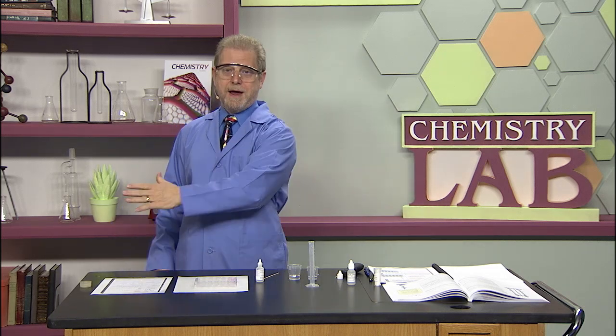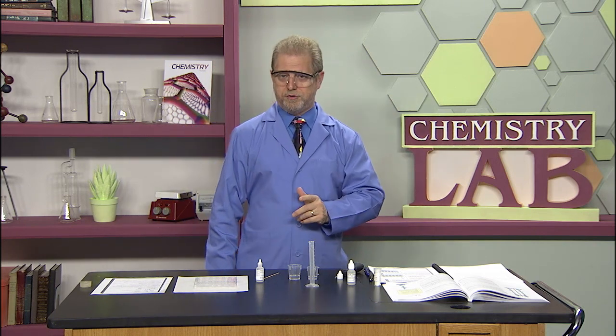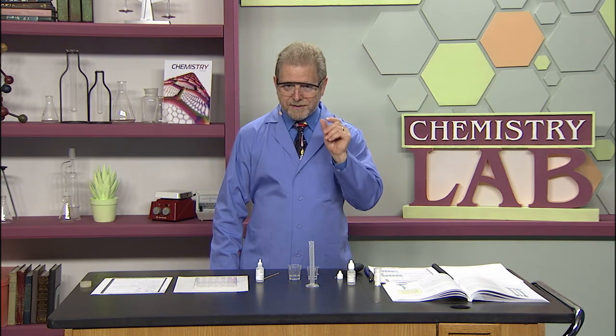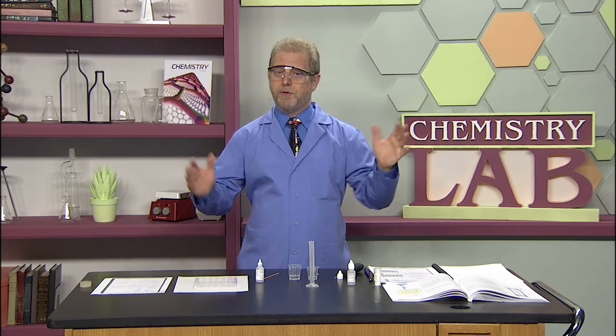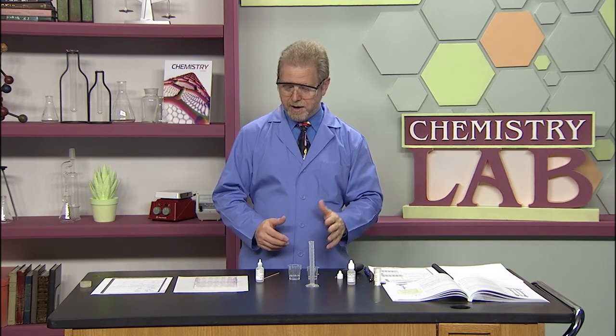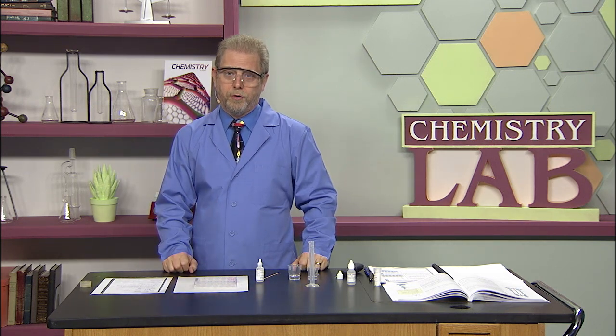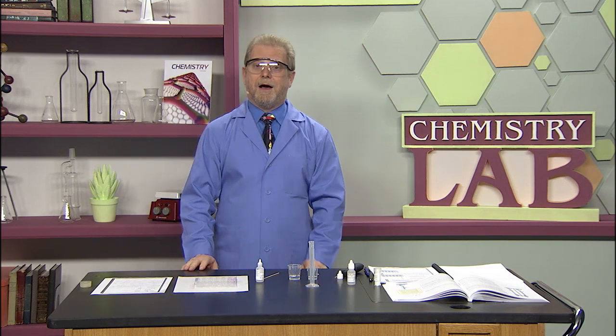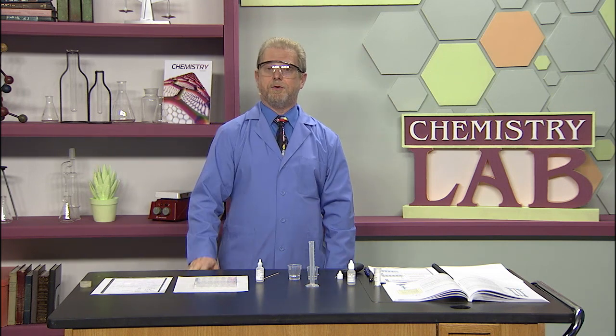I went way past to show you what you shouldn't do. You've got to take it easier. I'm doing it quickly so you have more time and get it to where that color will stay. Now the last thing we have to do is our calculations.